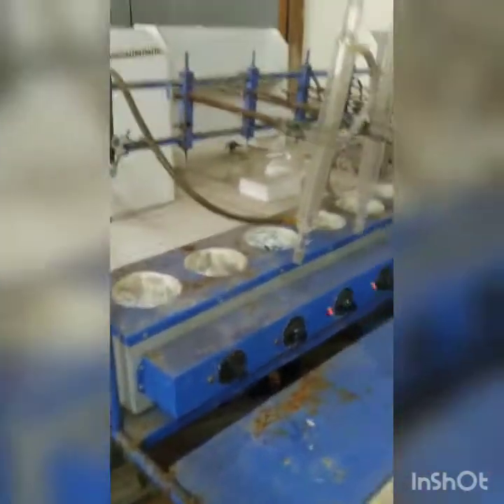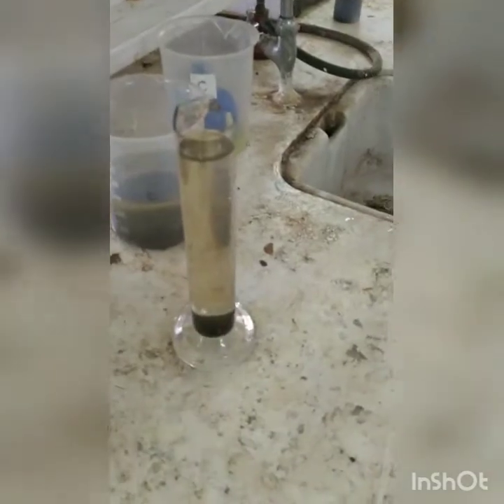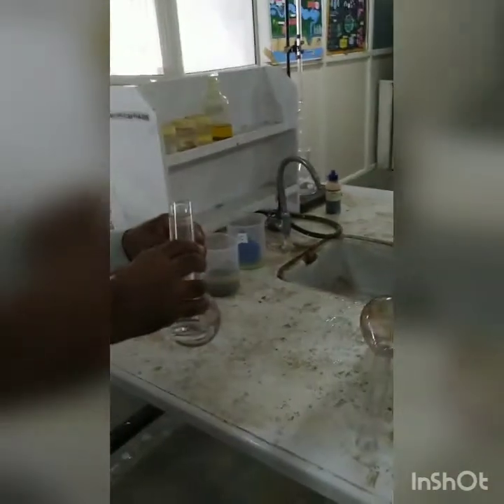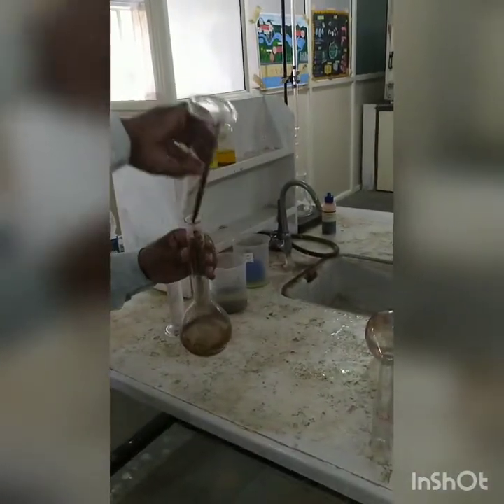Now we will go to the procedural part. So now we are ready with the digester sample. We have taken 100 ml of the digester sample. Now this digester sample will be transferred into the digestion flasks. Yes, it is 100 ml. We are going to transfer it into the digestion flask. So 100 ml is taken, well shaken sample was taken.